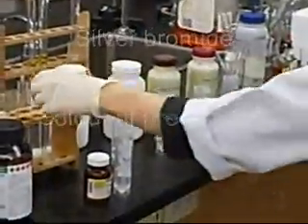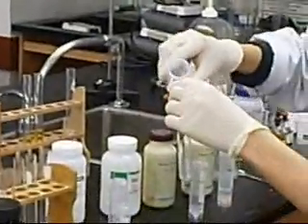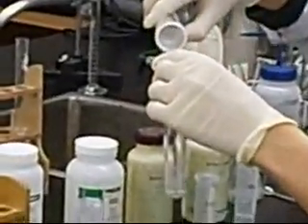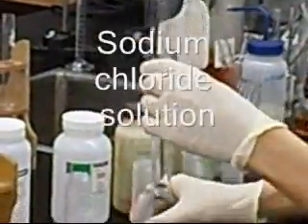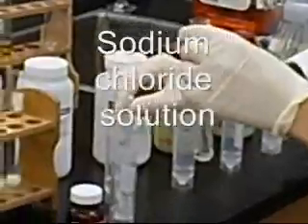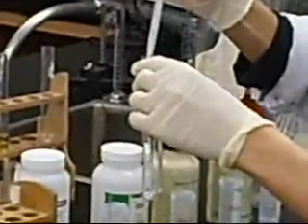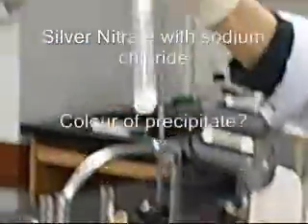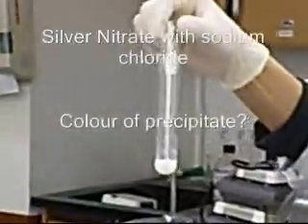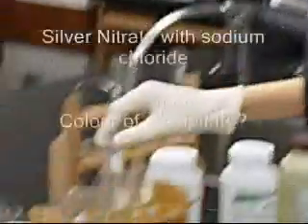And last, sodium chloride solution reacts with silver nitrate. Observe the color of the precipitate.